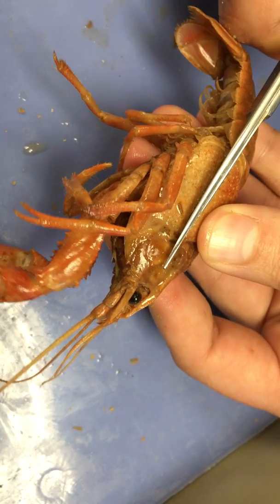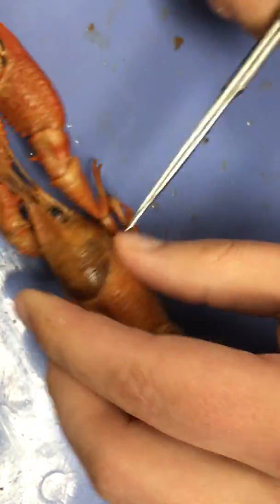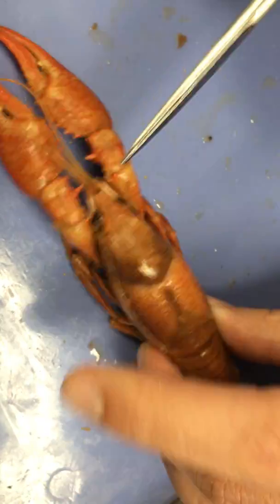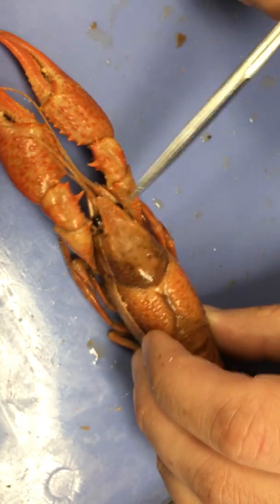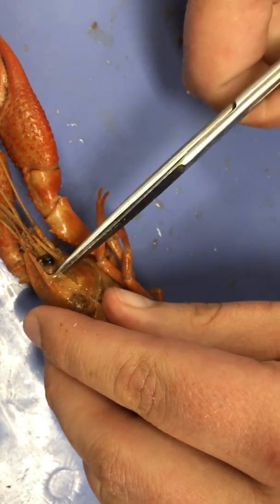Be sure to do this at your next family's crawfish boil. Once we have our two cuts along the cephalothorax meeting up with the eye, we're going to join that by cutting across so that we can peel this back very carefully.